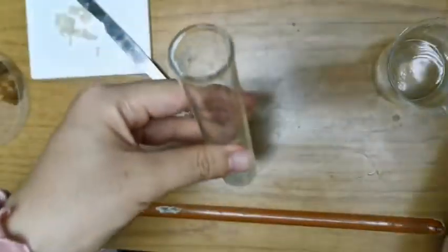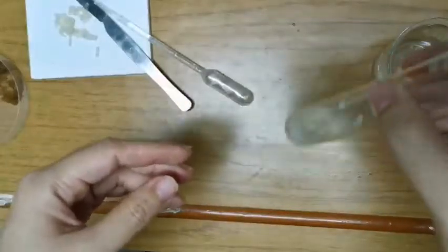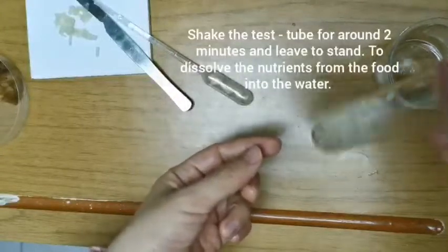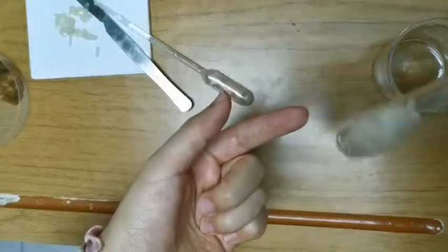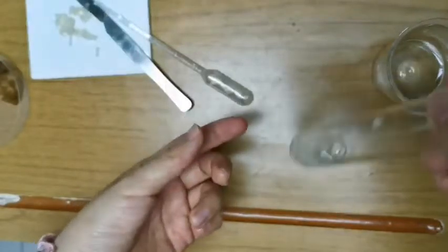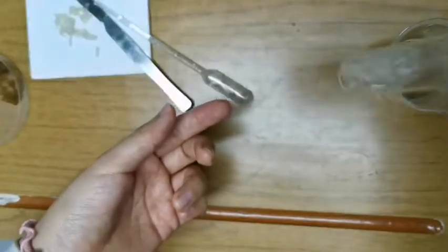Once you add that water, you want to shake it. The reason why you're shaking is, again, you want to dissolve any of those nutrients present in the food into the water. So essentially you are creating a solution that has dissolved nutrients in it. Shake it for about 1 to 2 minutes. Actually, 30 seconds is good enough, but if you're asked to write down the instructions, you want to write 1 to 2 minutes.